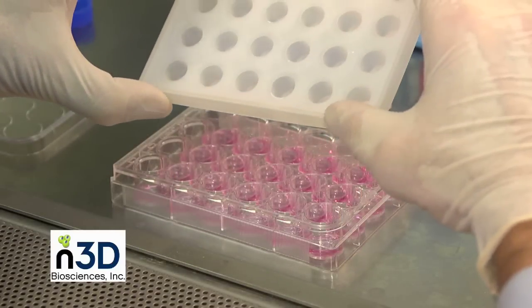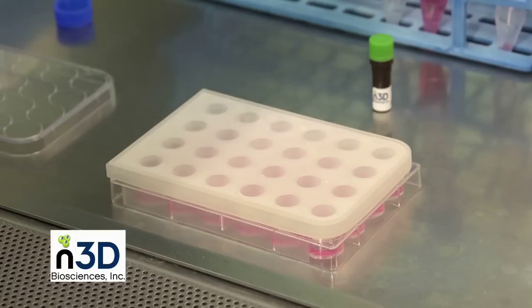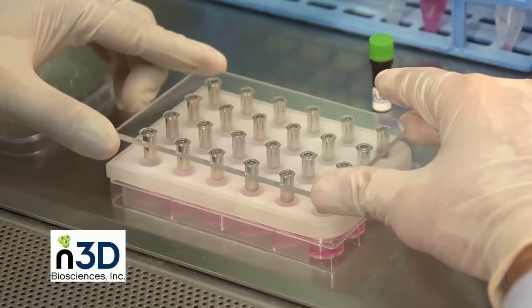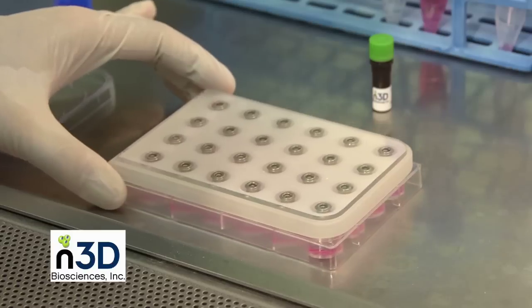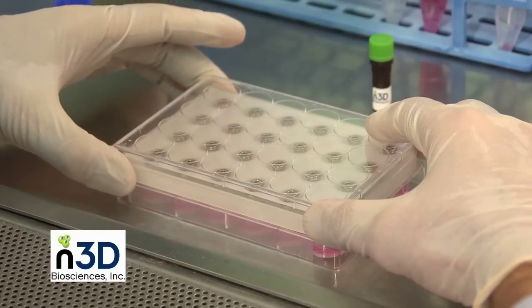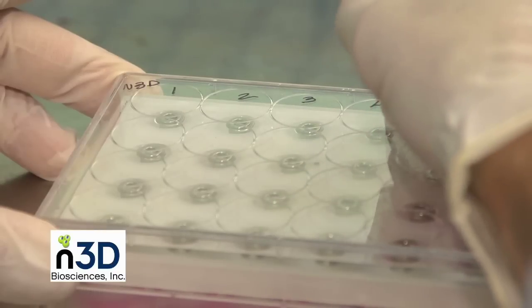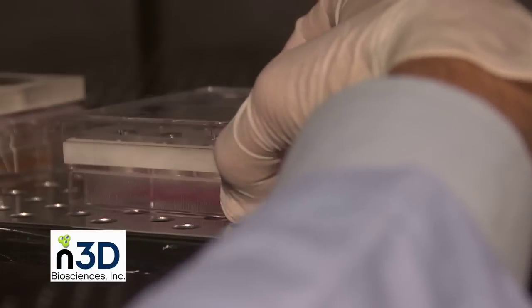On the 24-well and 96-well BioAssemblers, carefully place the culture isolation lid. Then place the driver assembly on the microwell plate with the NanoShuttle PL-treated cells. Gently agitate the plate with a side-to-side motion for 3 seconds, taking care not to splash the cells on the top cover. Place the clear lid on top of the magnet drive — labels may be written on this surface. The time between adding the cell suspension to the wells and placing the magnetic drivers on the plate should be kept to a minimum, less than a few minutes for optimal results.